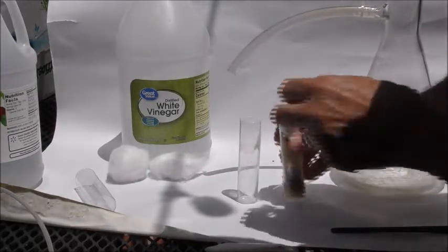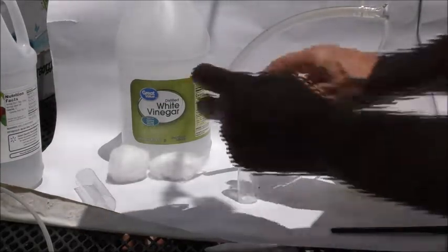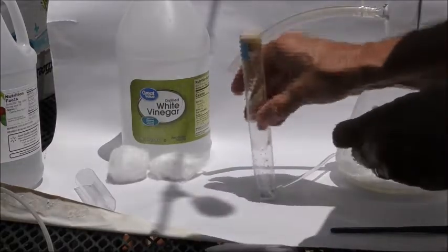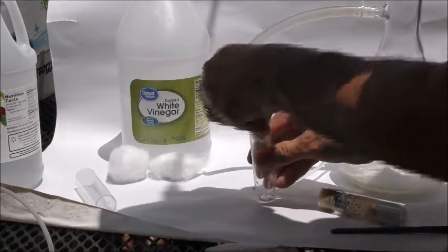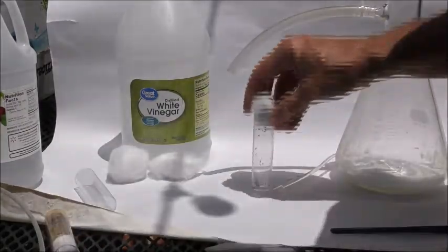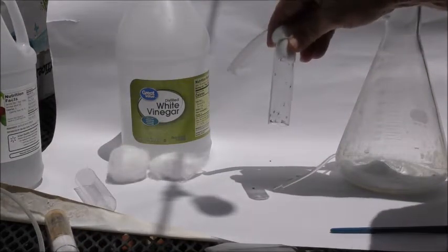Cotton balls, tap them down, transfer your flies like that, put that back in there. And good to do that outside so you won't have flies in the house.